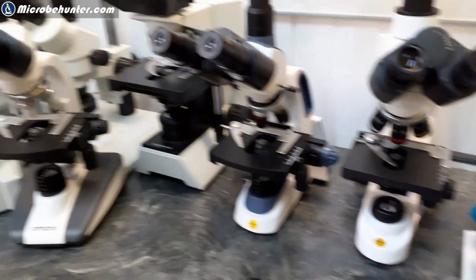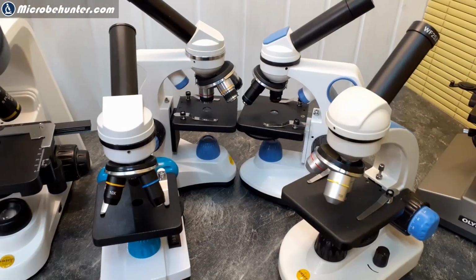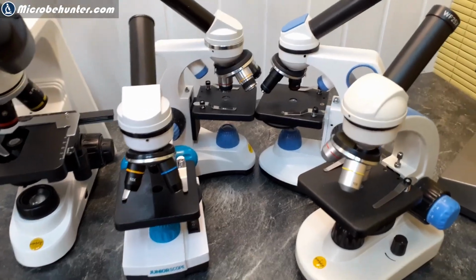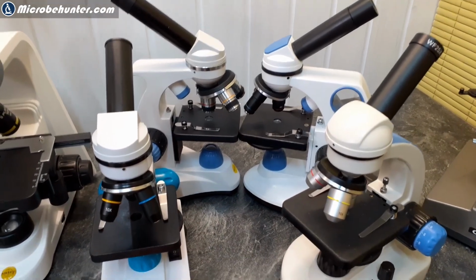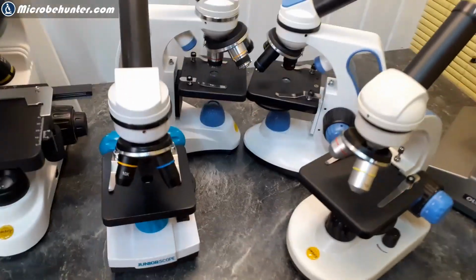So what should you get, in other words? Well, of all of these things, my general recommendation is if you are thinking about starting microscopy as a hobby, and if you're not really sure if it's something for you or not, then definitely start with one of those introductory microscopes to get your toes wet, as you say in English, because maybe you don't like the hobby, right?